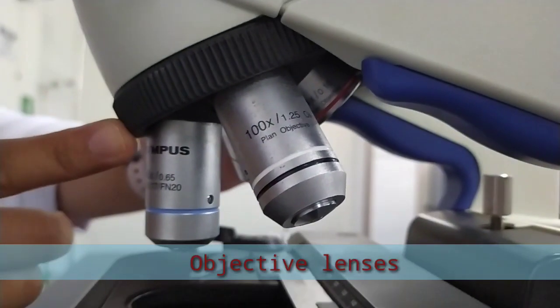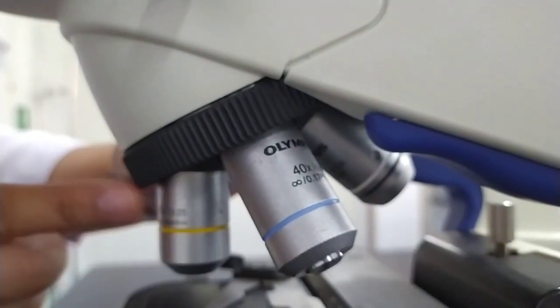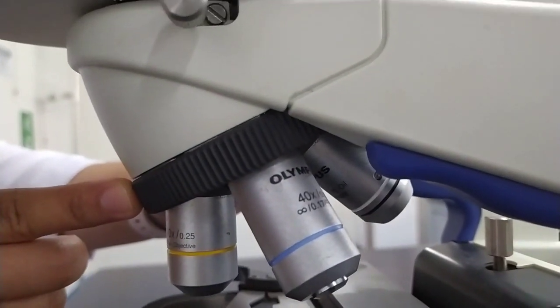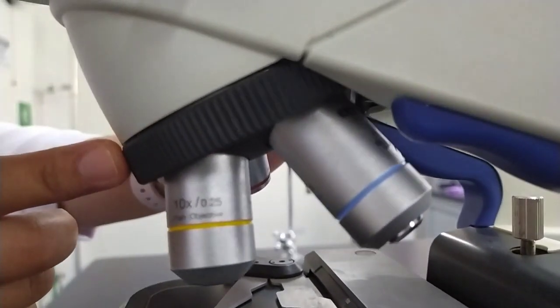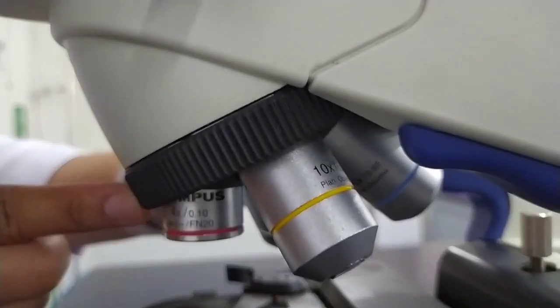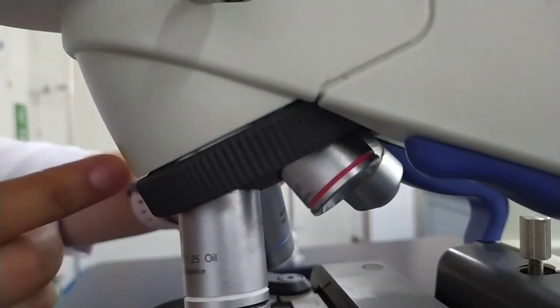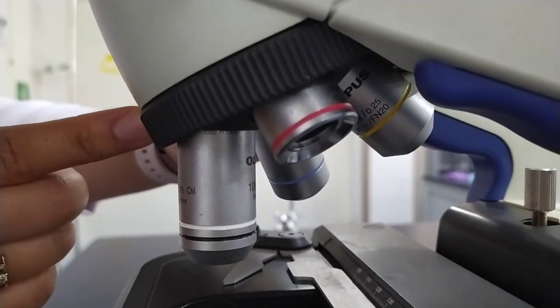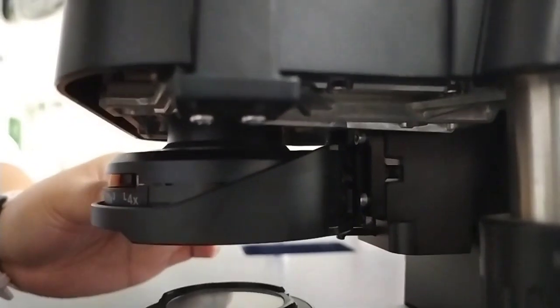Objective lenses. Generally, 3 or 4 objective lenses are found on a microscope with ranges of 10 times, 40 times, and 100 times powers. Lenses are color-coded. The shortest lens is of the lowest power, and the longest lens is high-power lens.